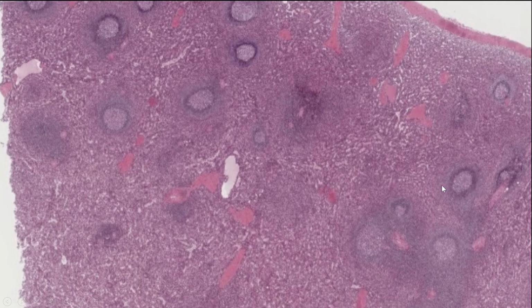Okay, and again, I know this can be confusing because you can very easily get confused between this and other lymphatic organs, right? But another way to look at this is the spleen does not have a medulla or a cortex. So these little white pulp things are spattered all throughout, instead of more towards the outside like it is in the lymph node. I know you could look at this and say this is a follicle with a germinal center, right? But it's not. It is white pulp and this is red pulp. We're in a completely different organ, so that name does not apply.